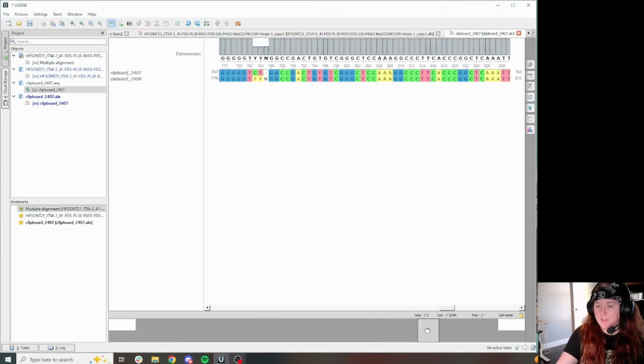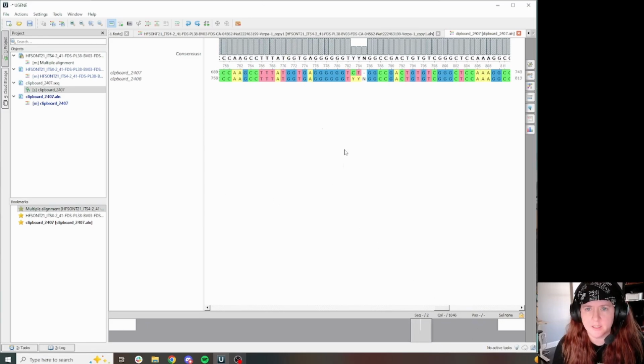Right, so I came across a little alignment issue when I was validating the sequence, and I wanted to kind of show you guys quick how I deal with these. I don't come across them that often, but they can be a little bit weird to deal with, right?